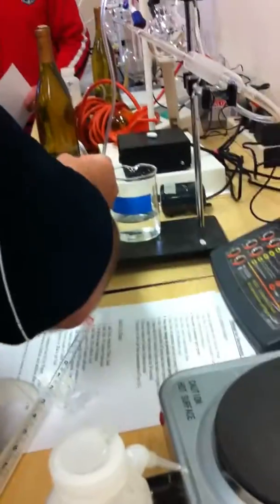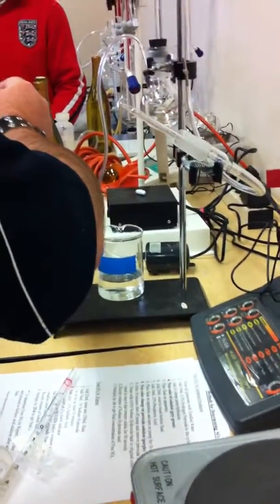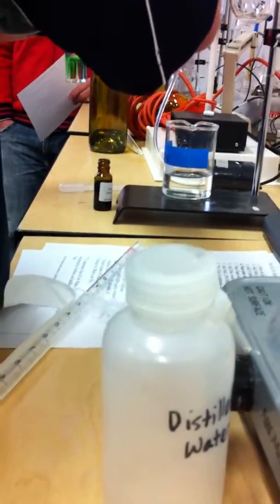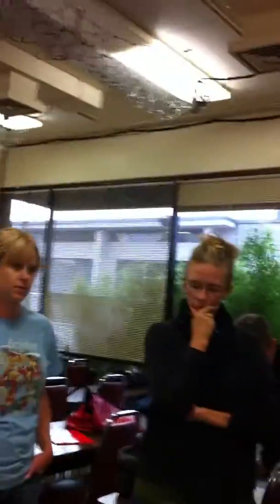So I wrote phenolphthalein, and this is, you can use this phenolphthalein, but they have this indicator right here. It says vacuum aspiration indicator. So add about three drops, and you want it to be this color, this kind of greenish color. Phenolphthalein does work, it's just a pH change measuring thing. So note this color, and you have that in bold. It's green. Because we're going to keep coming back to this color.